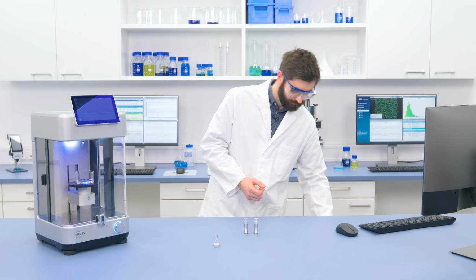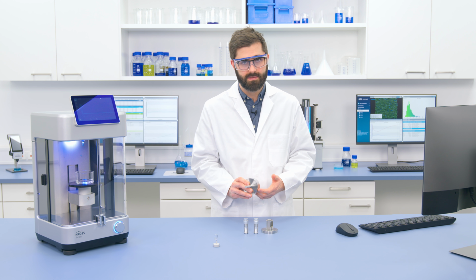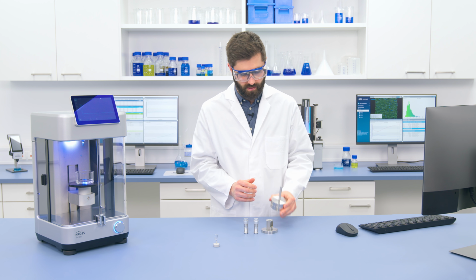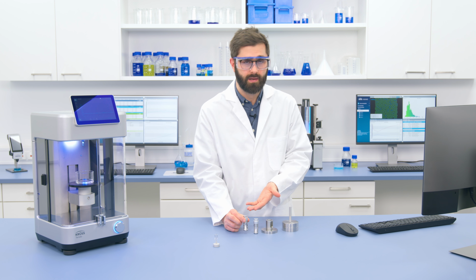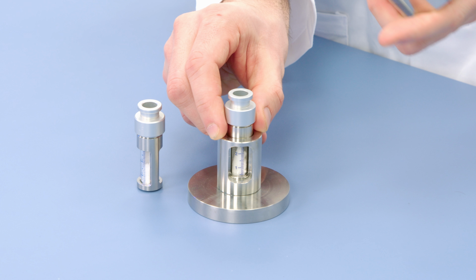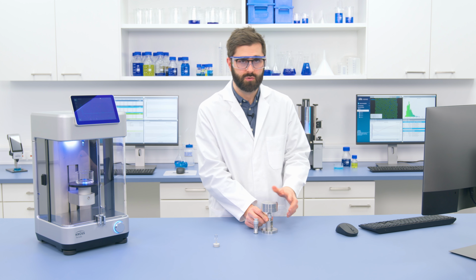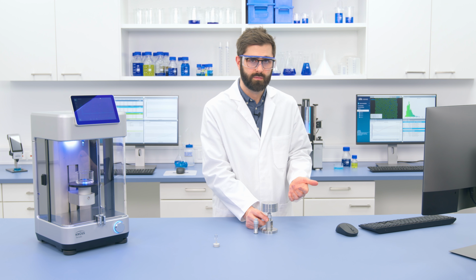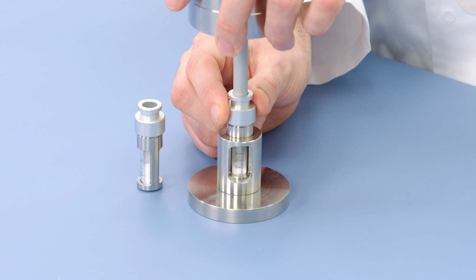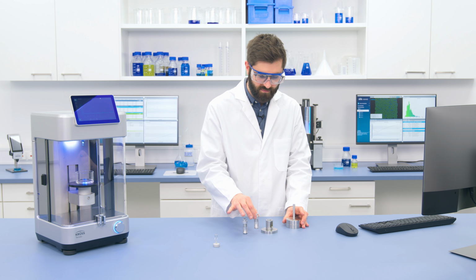In order to make these two samples as reproducible as possible, what we can do is apply our own compression. So for that, we have the compression weight set from KRÜSS, where we can take an exact weight and we can compress it for a certain amount of time. So in this case, I have 1 kilogram. All I need to do is take my first sample. I can sit it in here. And then from there, I can now apply the compression from above. And for this, I'll just count to 5: 1, 2, 3, 4, 5. Now I have my compressed weight of cellulose. And I can repeat this for the second sample.